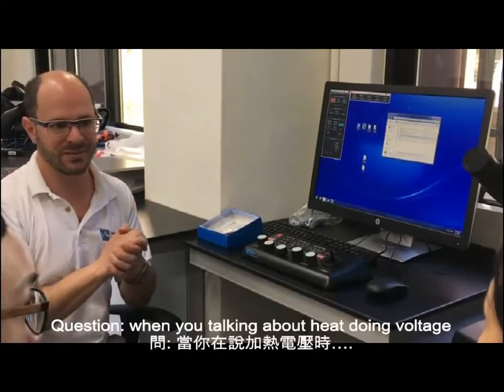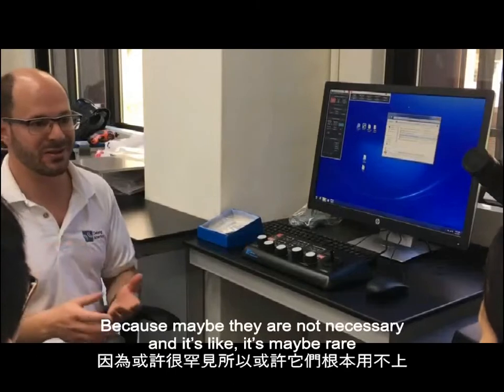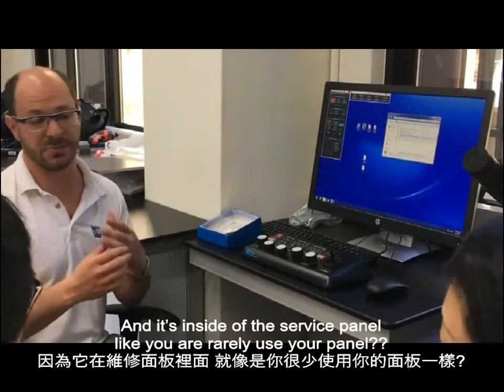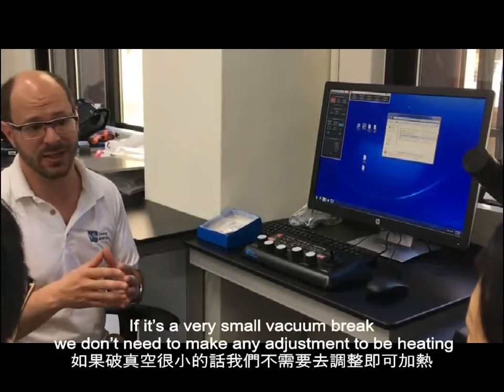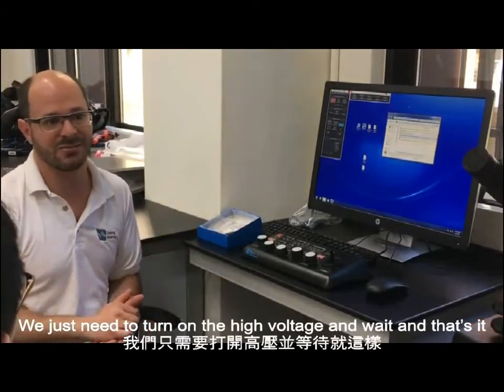Talking about heat, you mean like voltage? Heat, but those are details that I'm not going to tell you right now because maybe they're not necessary, it's maybe rare, and maybe you'll never need to do it, and it'll be too confusing. It's inside the service panel, not in the regular user panel. So it's kind of a special case, but in principle, that's what's happening. If it's a very small vacuum break, we don't need to make any adjustments to the heating. We just need to turn on the high voltage and wait, and that's it. So that's very fast.